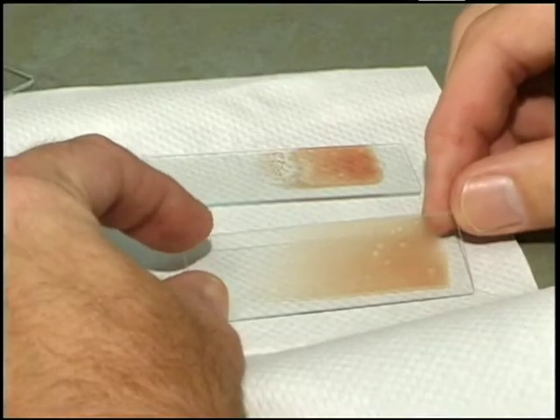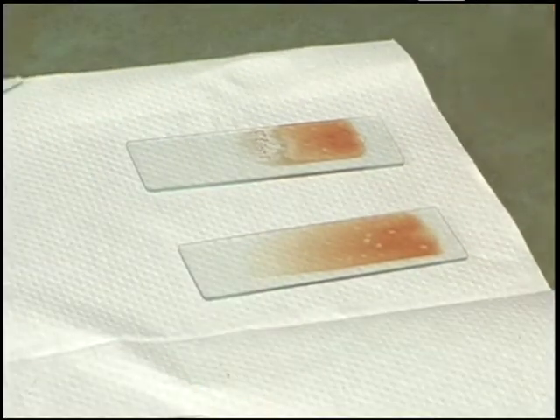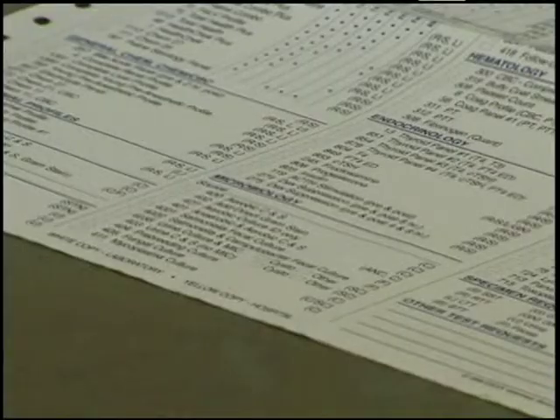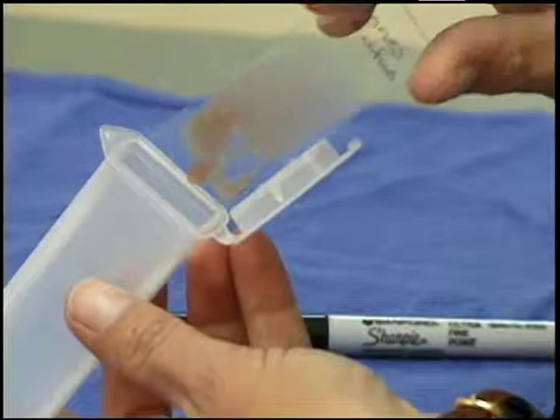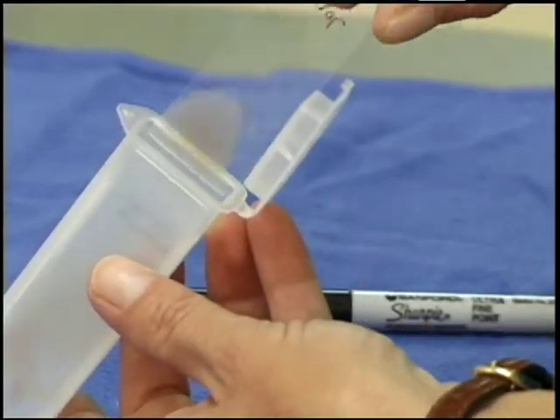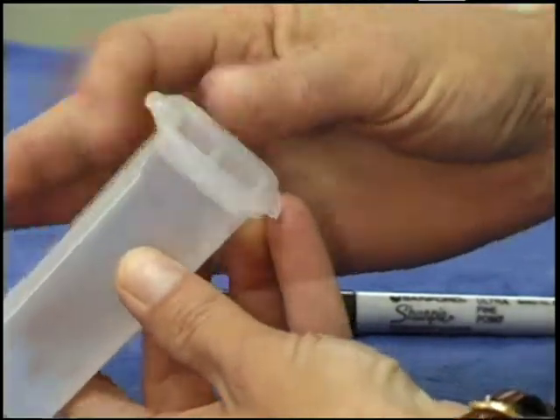After a second slide is made, the slides are set aside to dry. They can be fixed and stained after drying, or can be sent to a commercial laboratory for assessment. Regardless of how slides are prepared, when shipping them, always send them in a slide case, such as the one shown here.